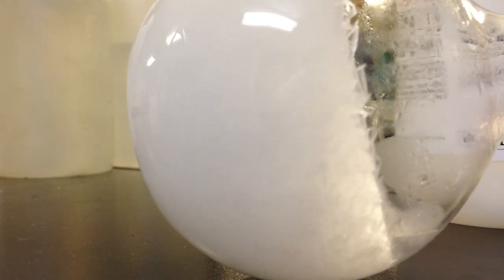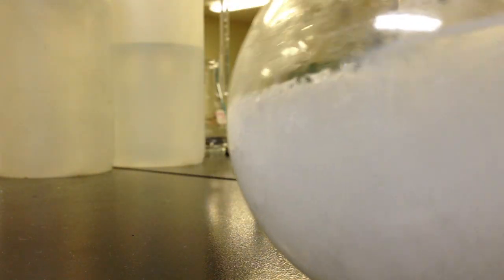Now when I tilt this to the side, you can see it looks like a big chunk of ice, doesn't it?